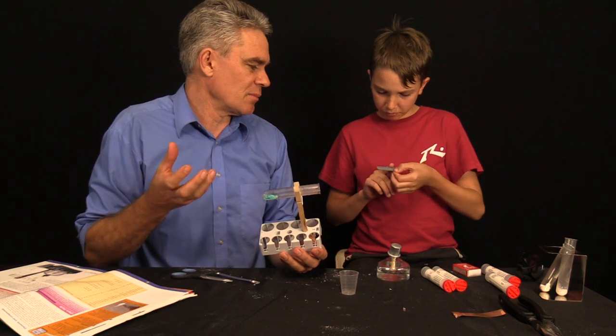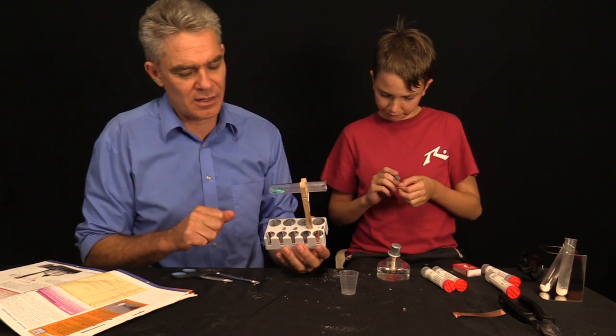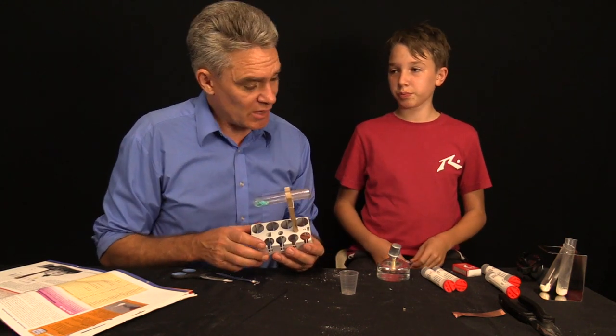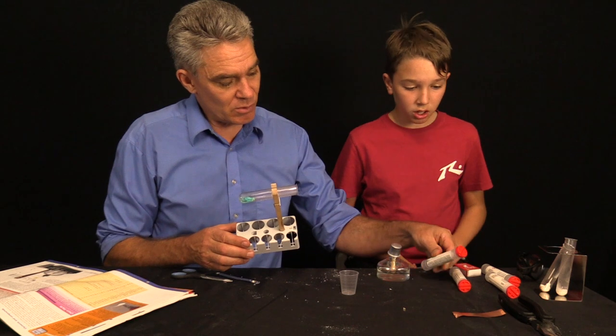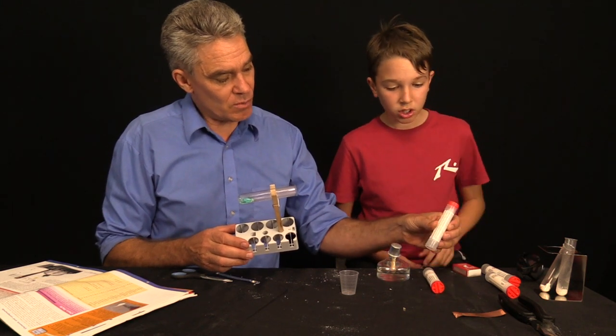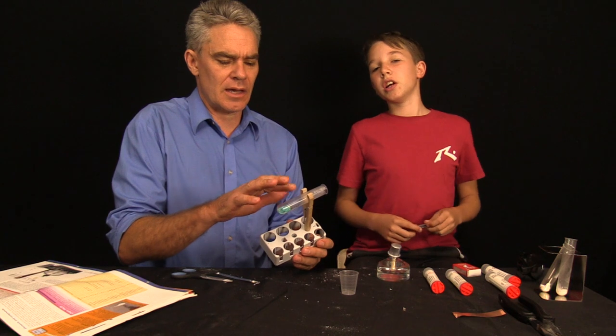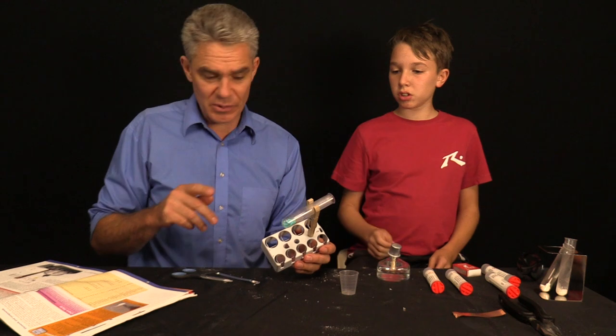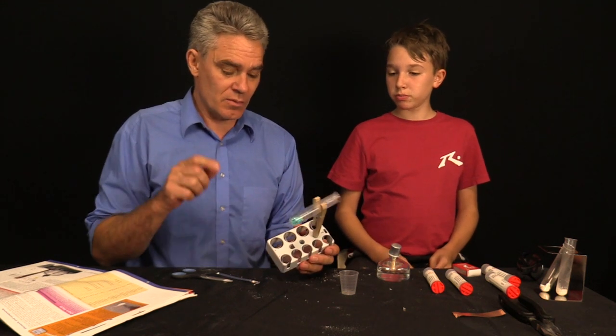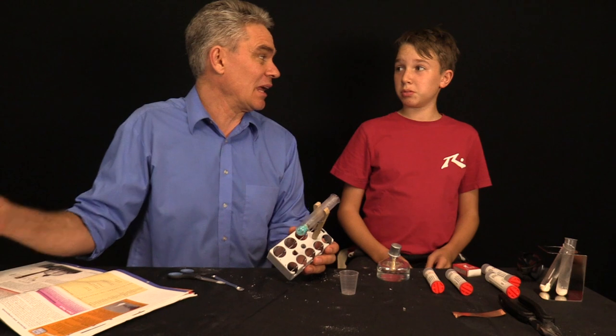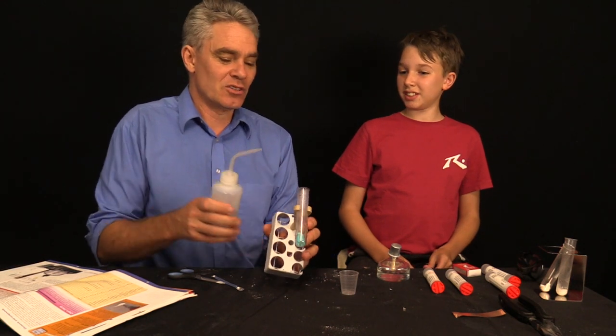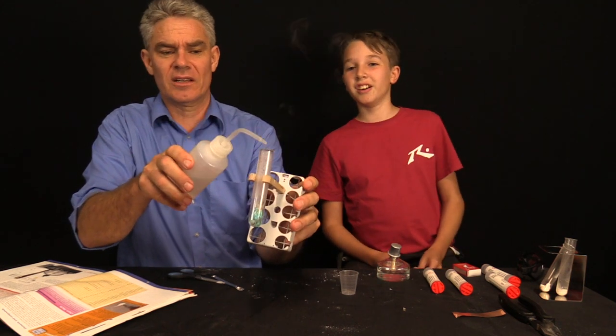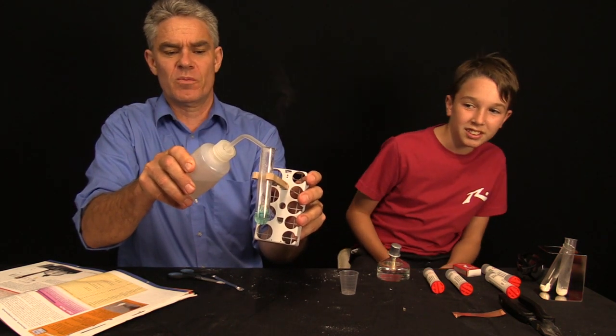Well you can actually get copper sulfate in rocks. There's some mineral rocks that are composed of copper sulfate. But in the laboratory, we've just made it with copper and what was the other chemical? Sodium hydrogen sulfate. Now, the question is, has that cooled down enough for us to pour in a little bit of water? Probably. Because what will happen if it's not cooled enough? It will crack the test tube. I don't want it to crack the test tube.